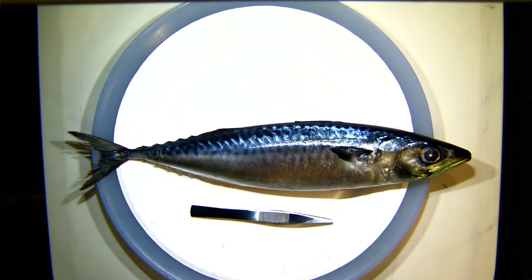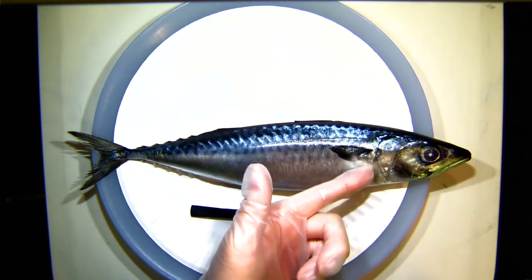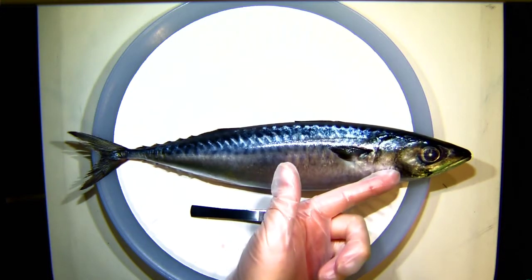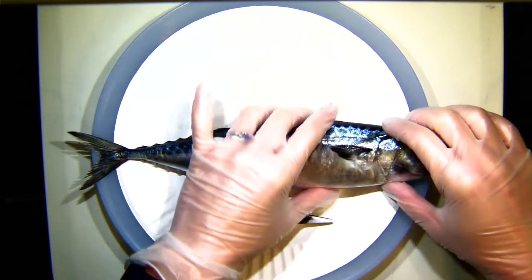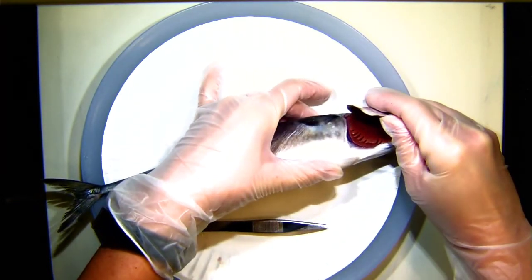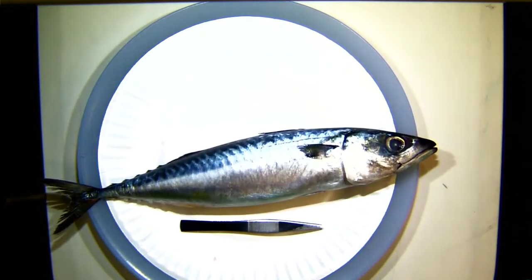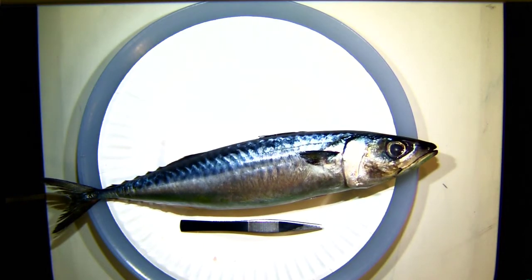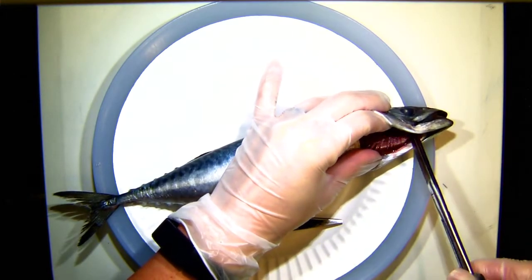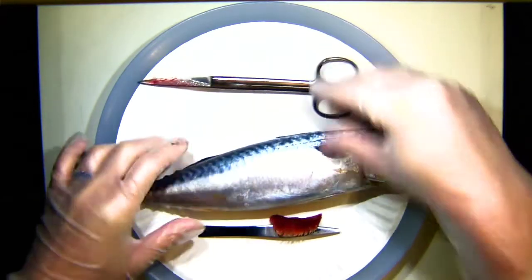We said it has a backbone, and the other thing is gills. Where are the gills on this fish? Many of us are pretty accustomed to gills on fish — it's this little flap right here. This flap itself is called an operculum. It's actually a protective flap because the gills are just inside. So if I lift this here, you can actually see those gills down in there. We can cut out the gills so we can take a better look at what they actually look like.